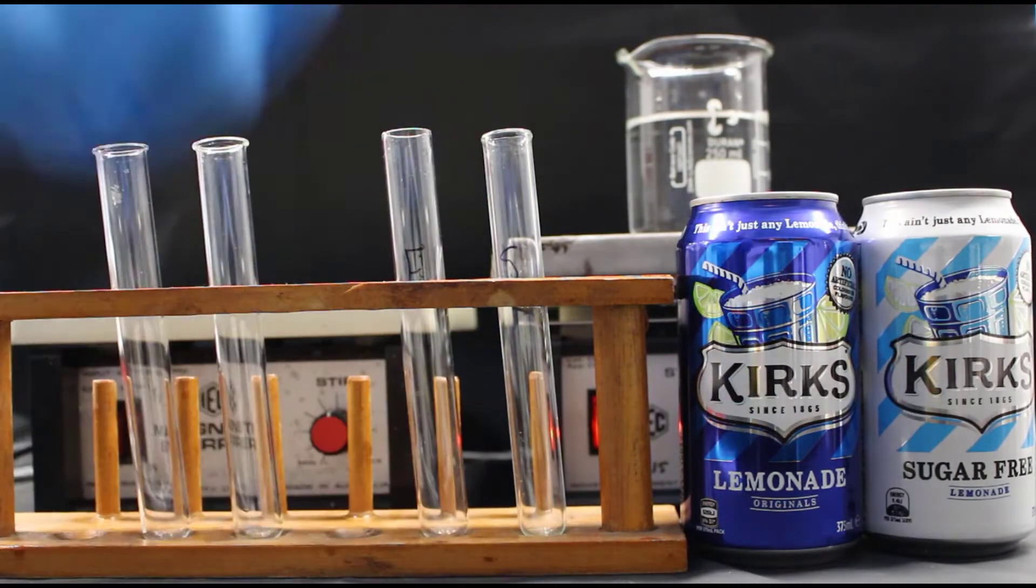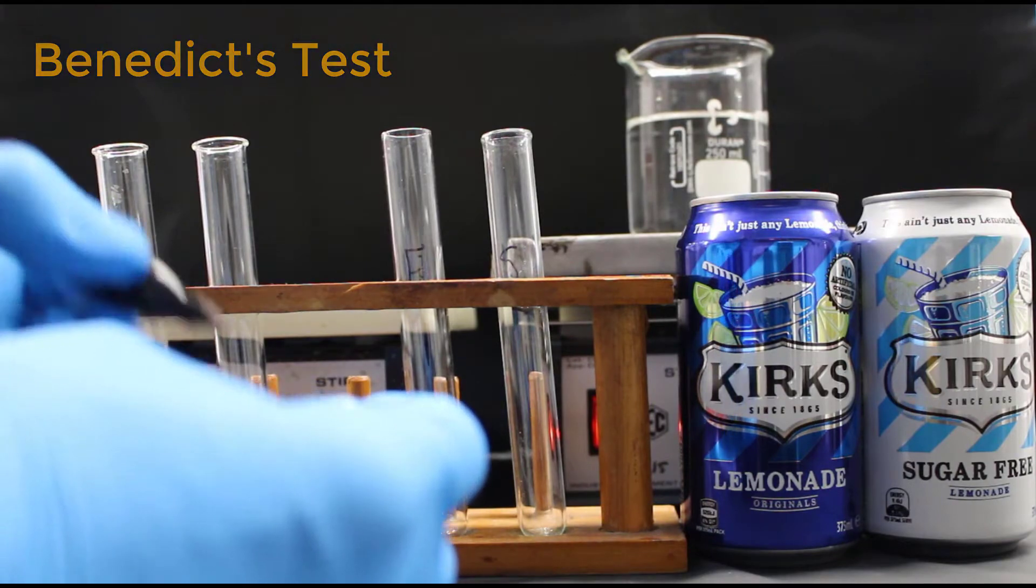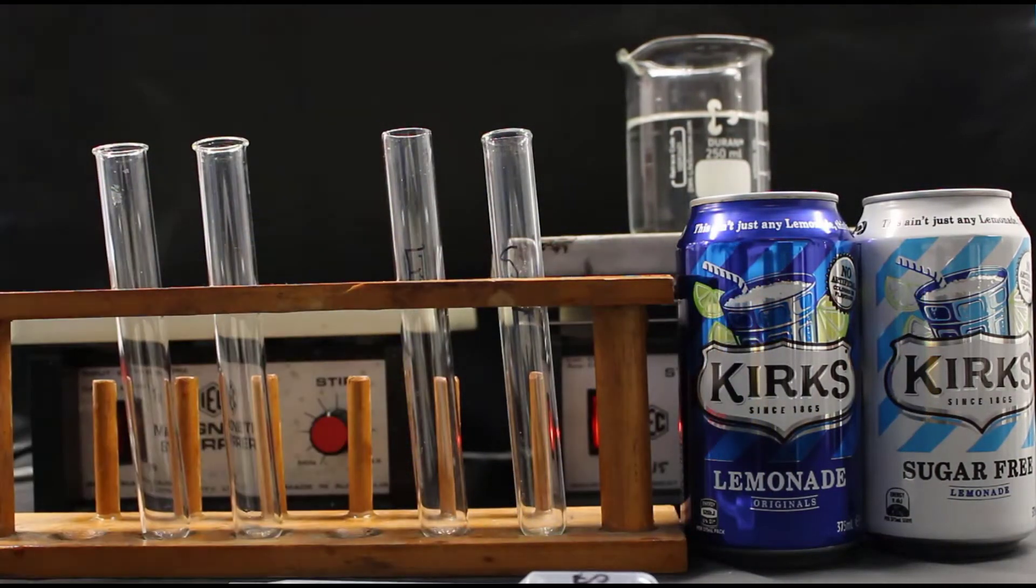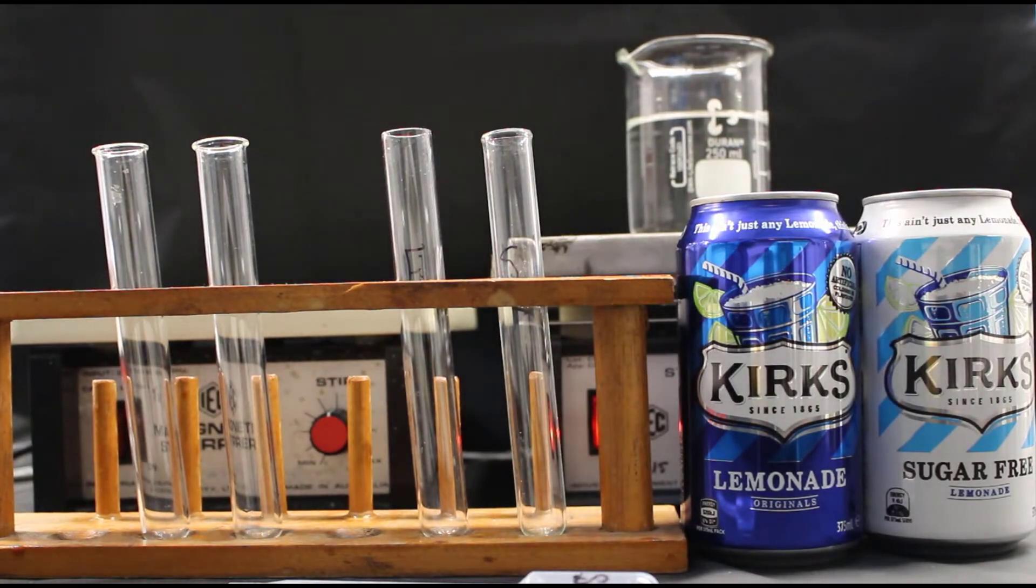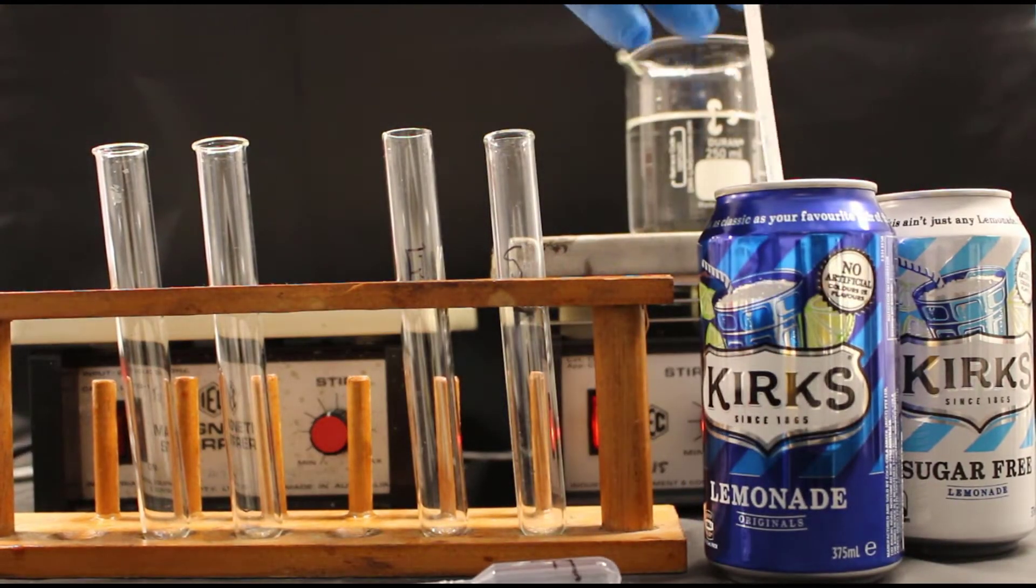The first test is called Benedict's Test. I start by labeling the test tubes and the transfer pipette to make sure there's no cross-contamination. I then put 5ml of the lemonade into each of the test tubes.